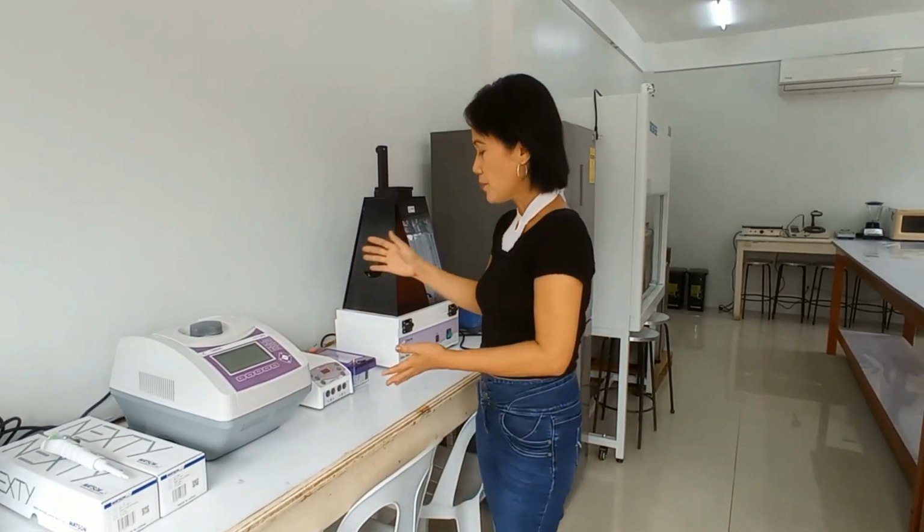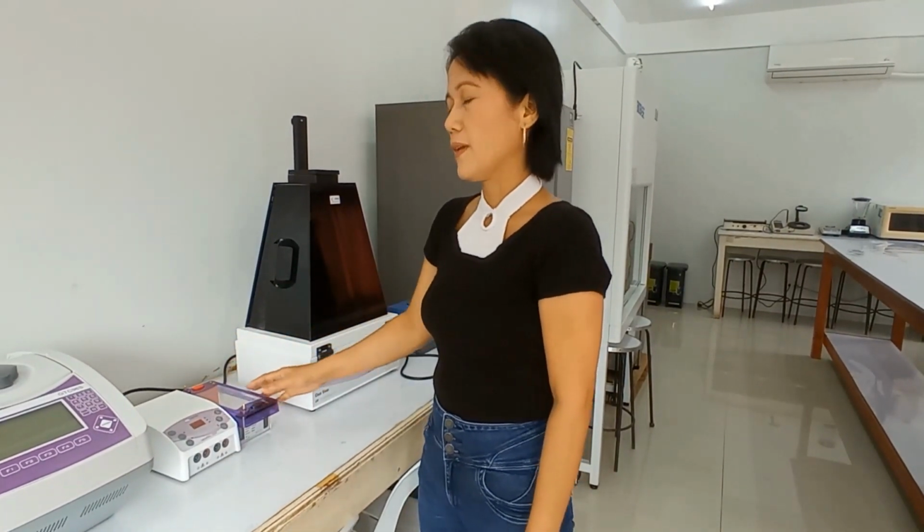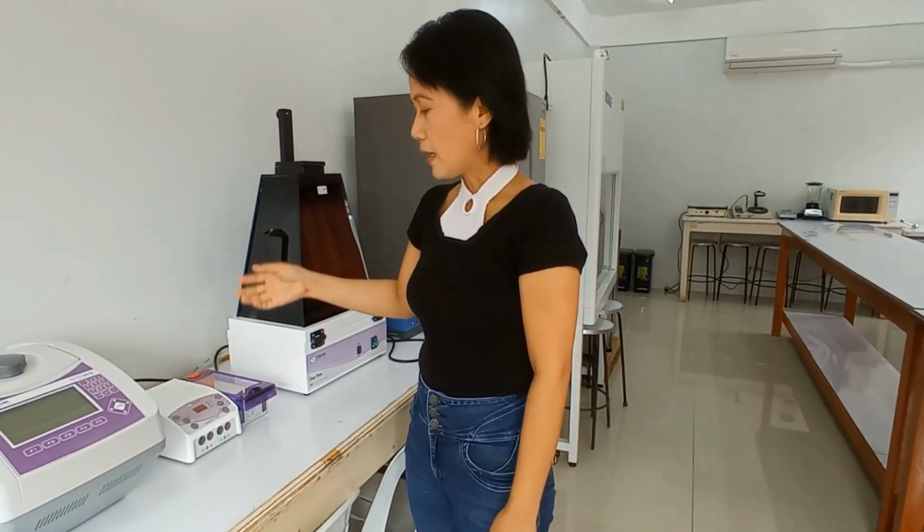And that gel must be loaded in here in this gel electrophoresis. Inside, the DNA fragments, including proteins as well, can be separated. DNAs are negatively charged, and so the DNA are pulled towards the positive electrode. From here, how do we know that we really have the amplified DNA?